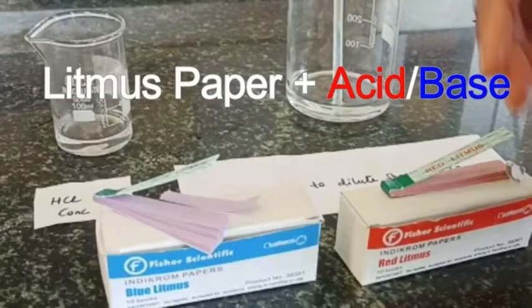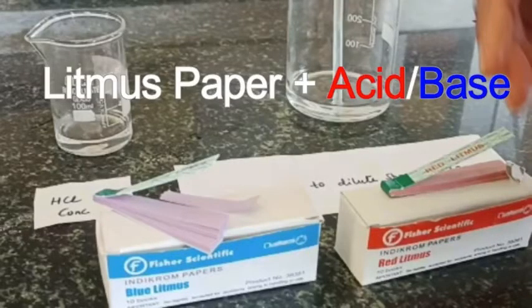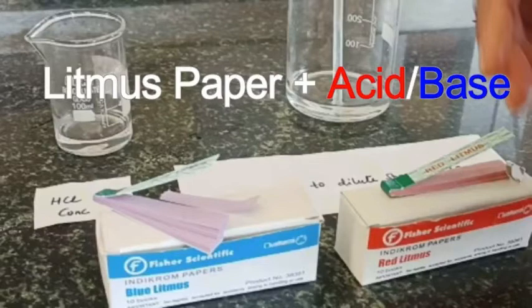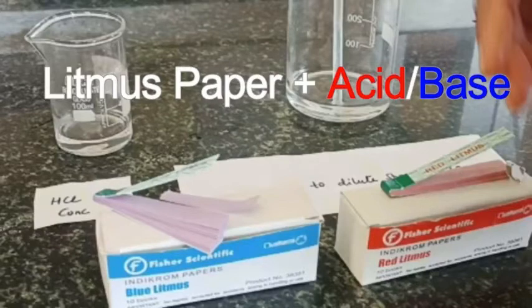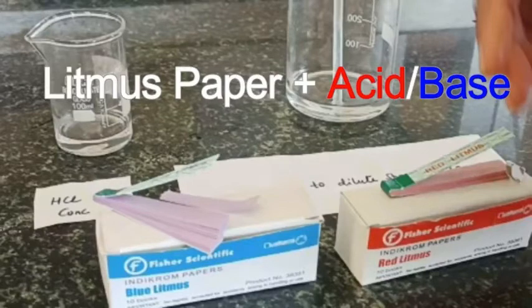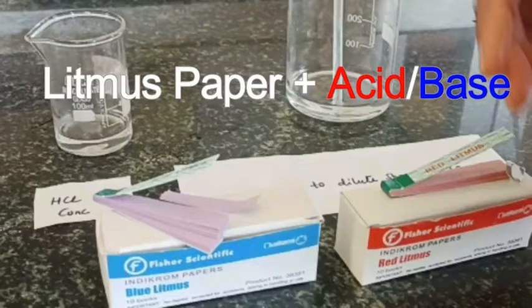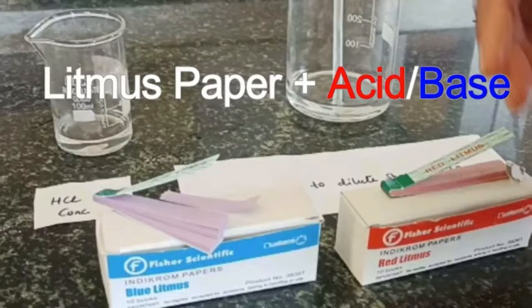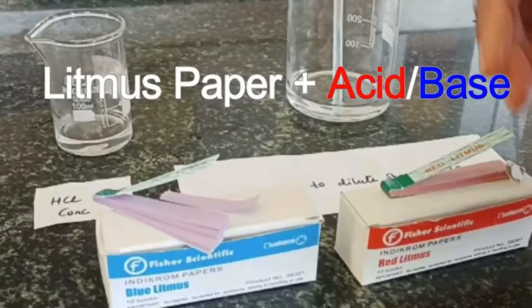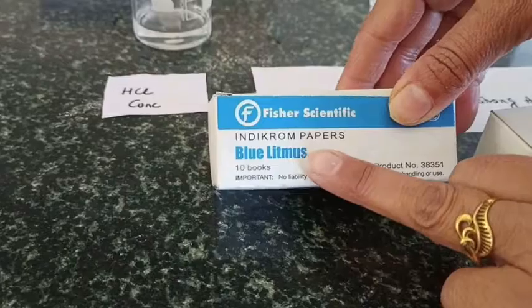Hello everyone, welcome back to Spectrum Classes. This is another lab activity video, and in this video we are going to perform an experiment related to litmus paper and its reaction towards acids and bases.